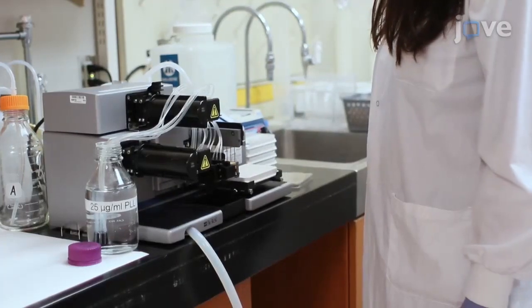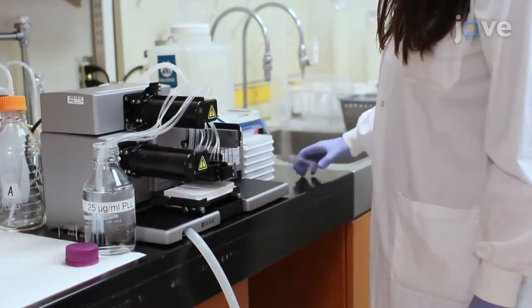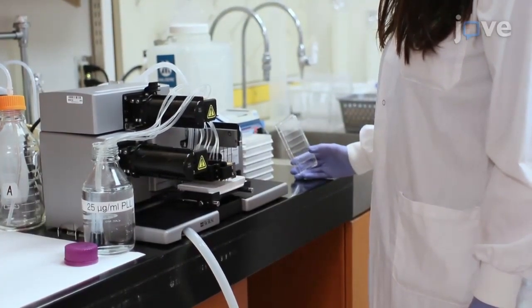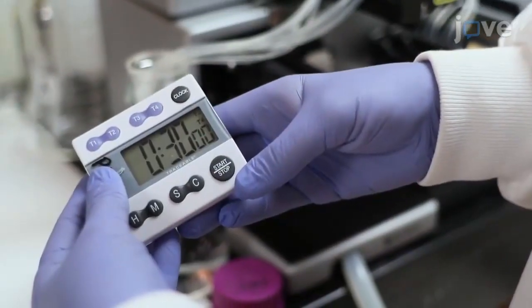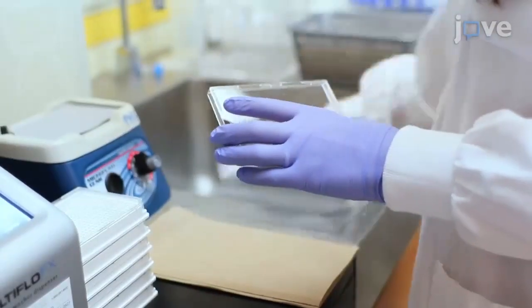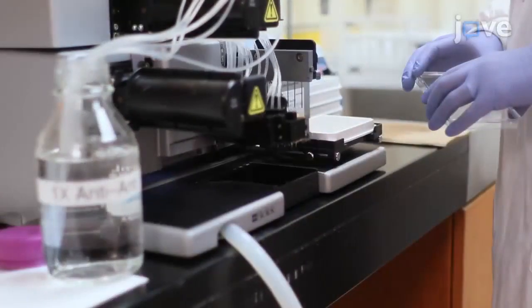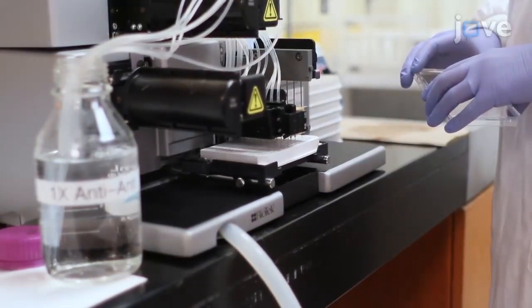Before beginning the procedure, add 20 microliters of a 25 microgram per milliliter poly L-lysine solution to each well of the appropriate experimental number of 384 optical bottom plates and incubate the plates at room temperature for 30 minutes to 2 hours. At the end of the incubation, flick the plates over the sink to remove the excess poly L-lysine and add 40 microliters of antibiotic anti-mycotic solution to each well.